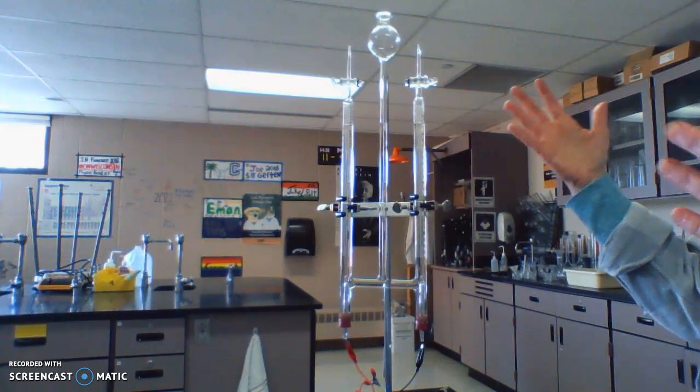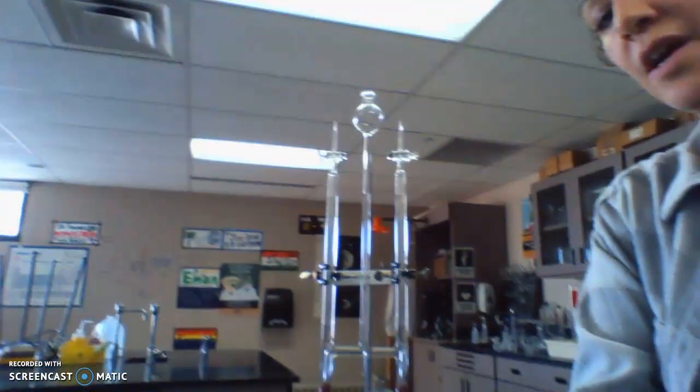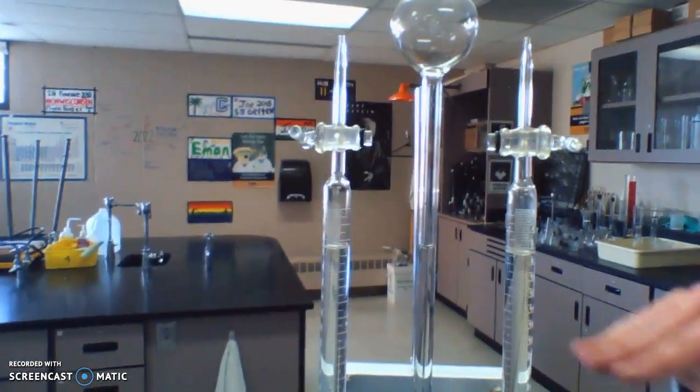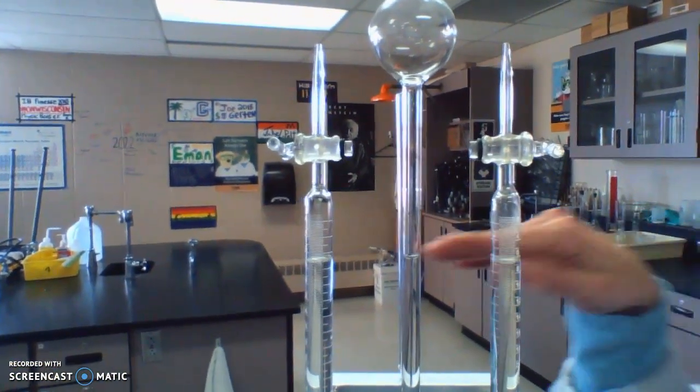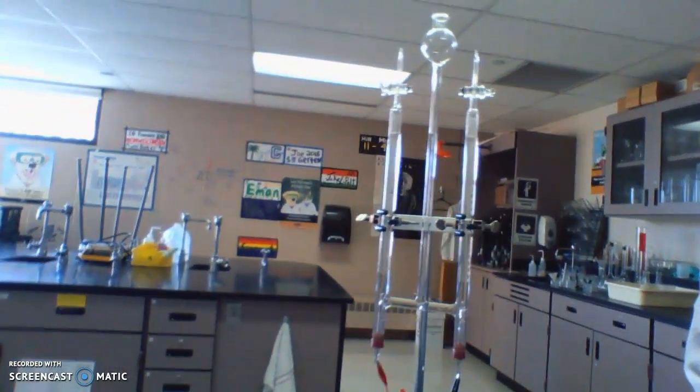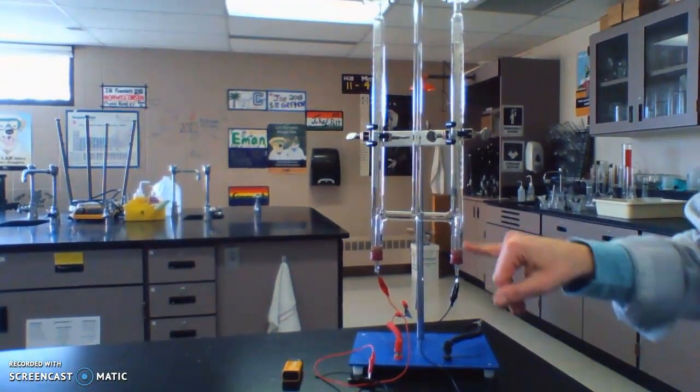If I turn it sideways, now it's blocked so no air can come and go. The water level in the tubes right now is here in the middle, and you can see that they're all even.